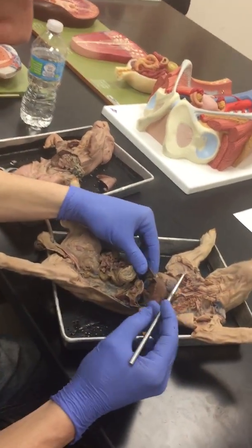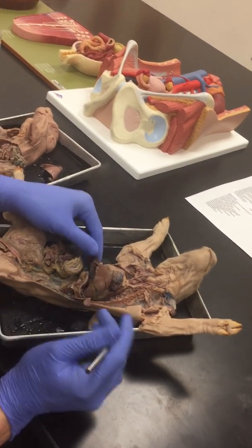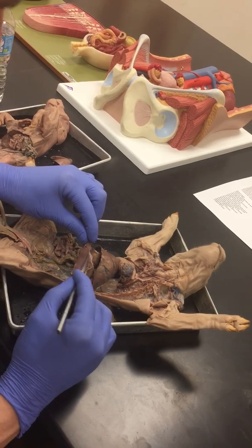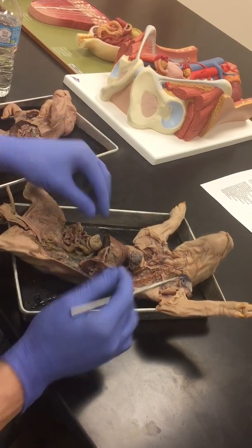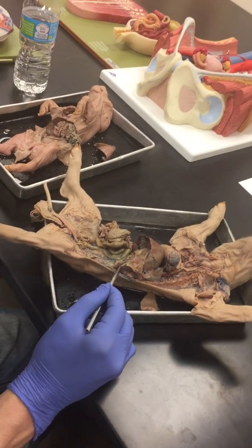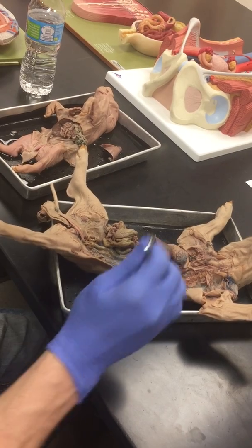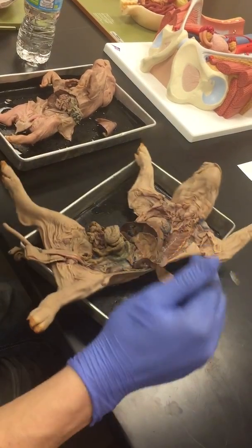So the gallbladder, if you look underneath the liver, is going to be right there, that little sac. The stomach is this bag, and then the spleen is about the same color as the liver there. They have a weird shaped spleen compared to ours. But if you lift the stomach up, you'll see this brainy material right there. That brainy material, that glandular tissue, is the pancreas gland. The pancreas gland is underneath the stomach. So the stomach is there, lift it up, and there's the pancreas.